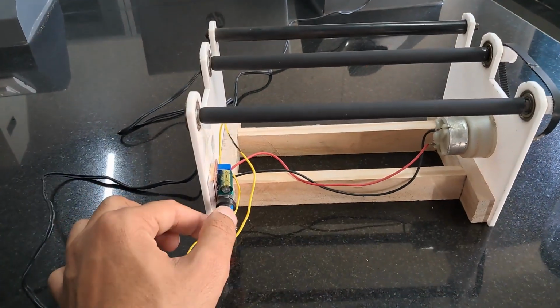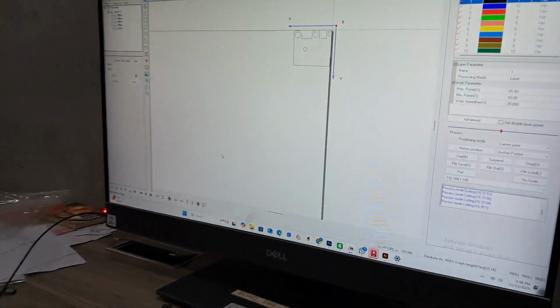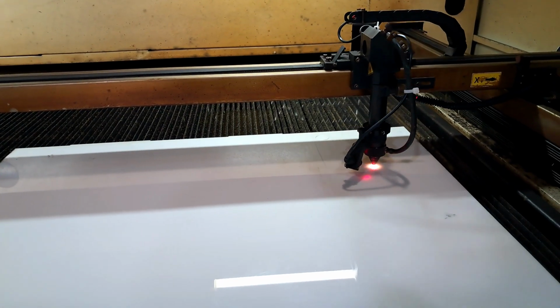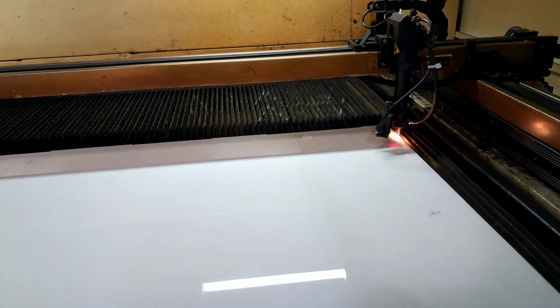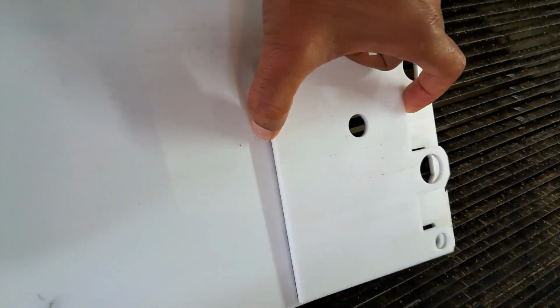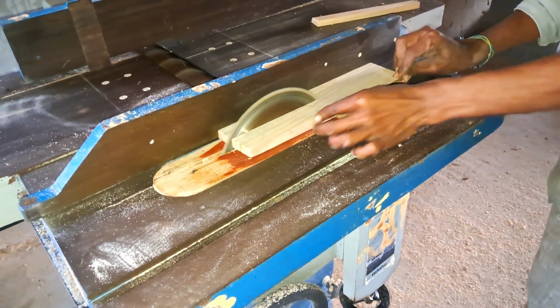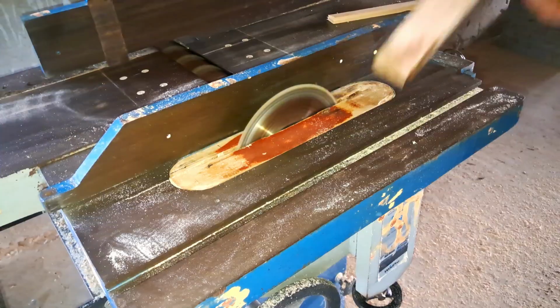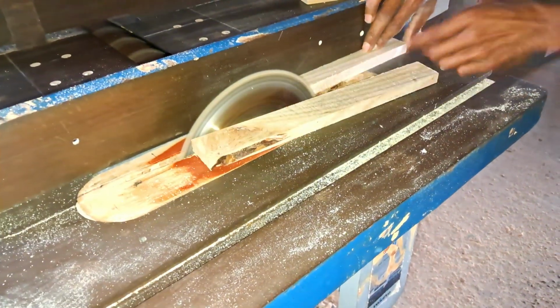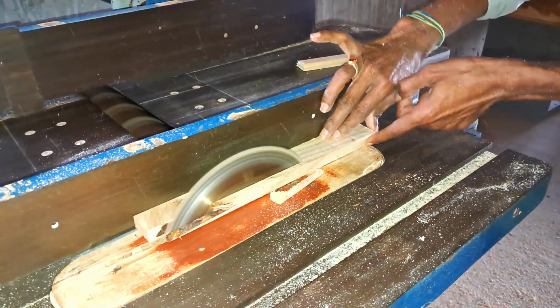So here in this video we are going to make a ball milling machine, and here I have designed the supports which I will cut on the acrylic sheet. So here we have cut two equal size of supports, and to make the base I am taking a wood piece. I will make an I shape from this wood, and it will hold our supports.